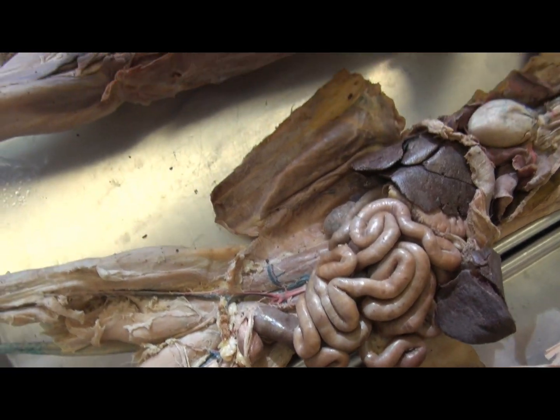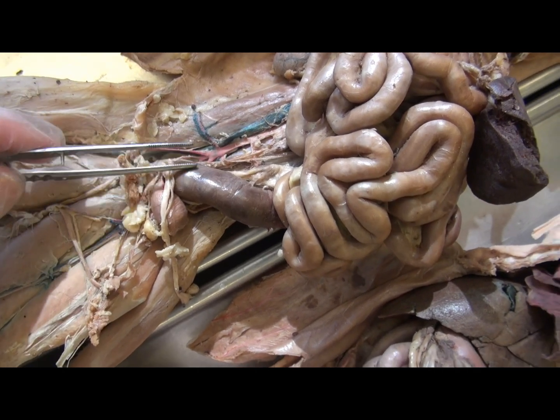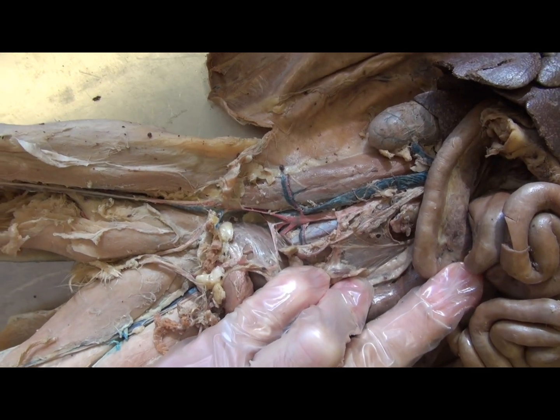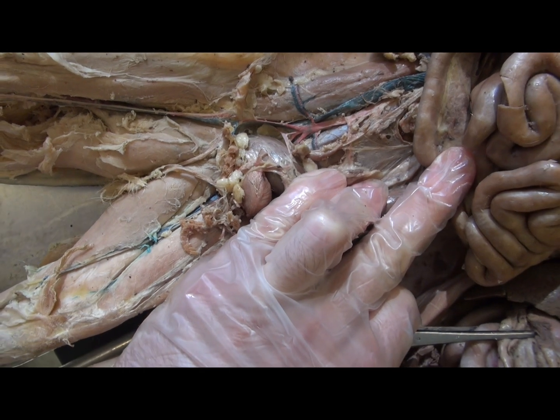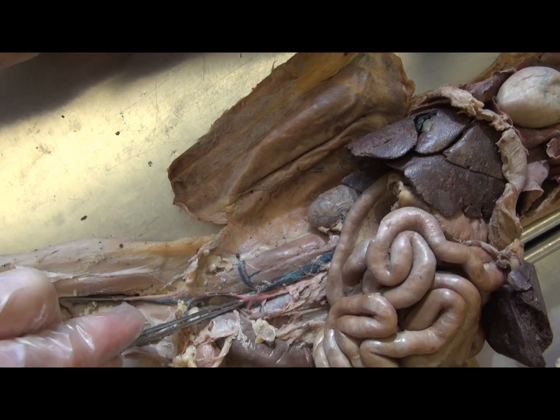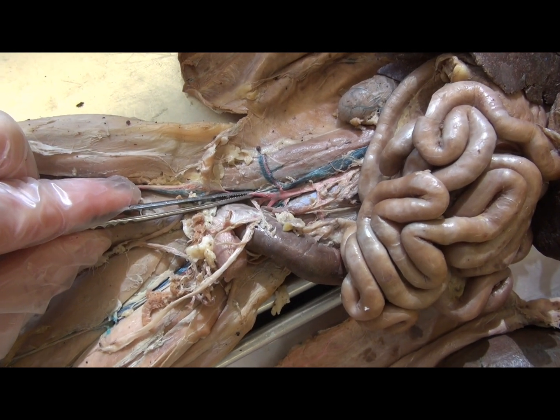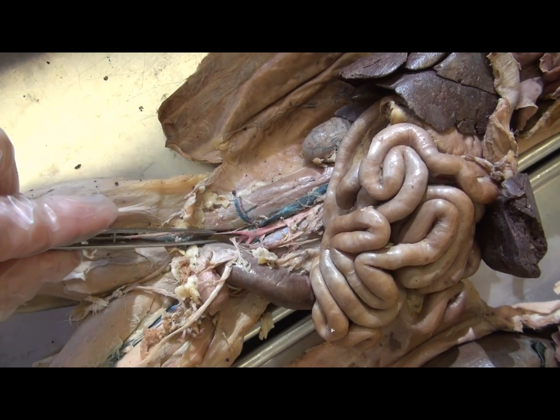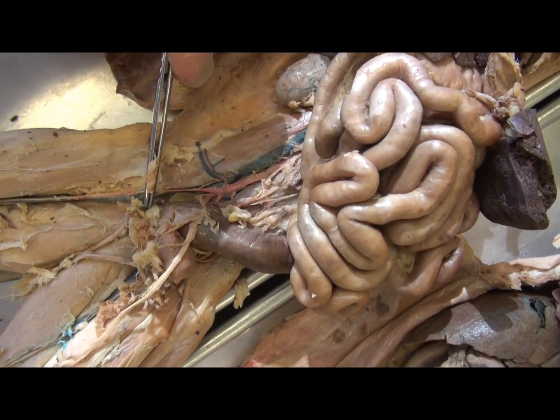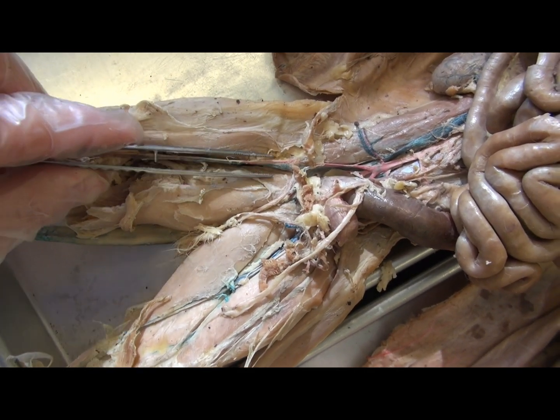Here in the cat, one can observe that in the abdomen we have an abdominal aorta and an inferior vena cava. When these vessels reach the region of the hip and the ilium, they branch to form iliac arteries. In the cat, there is no common iliac artery — the internal iliac does not fuse with the external iliac as it does in humans. While there is a common iliac vein in cats, there is not a common iliac artery. The external iliac artery crosses the body wall, leaves the pelvic cavity, and as it passes along the thigh and femur it is known as the femoral artery.